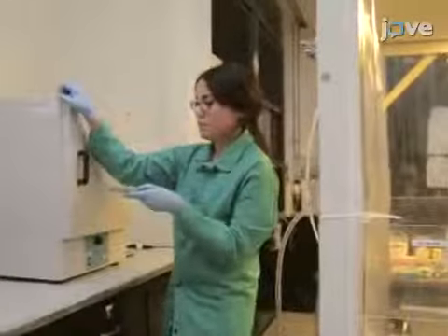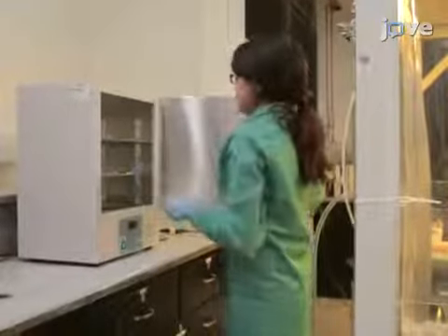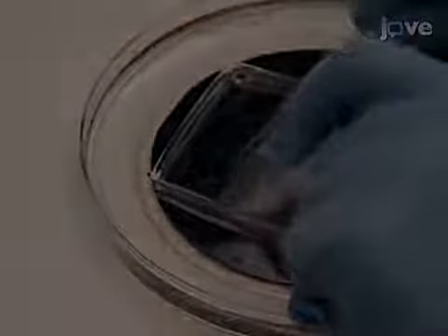Follow the degassing by baking the mixture for an hour at 75 degrees Celsius to cure the PDMS. Next, cutting with a scalpel, carefully remove the barcode mold. Then, carefully peel the slab from the wafer.